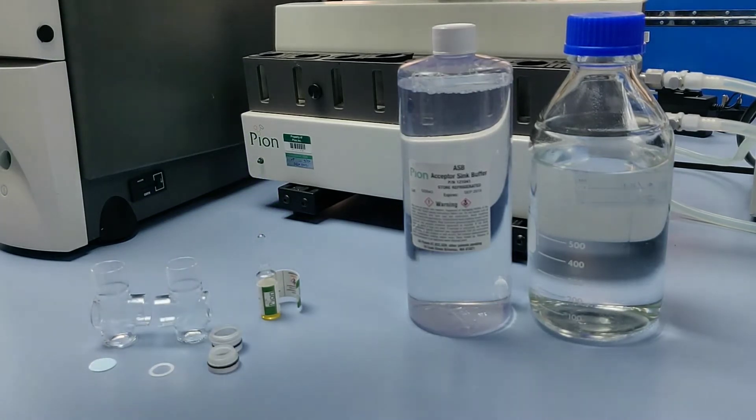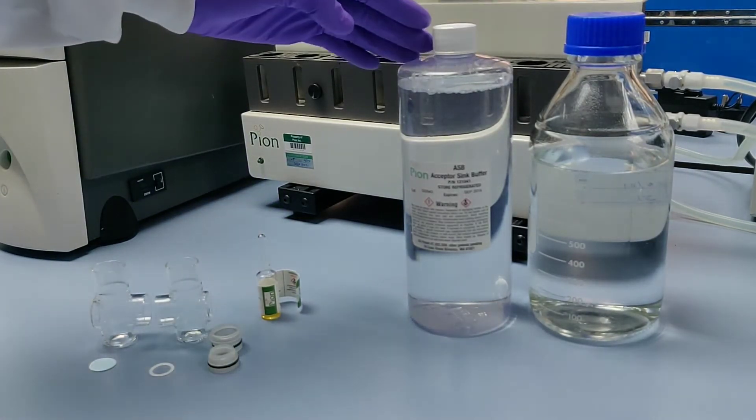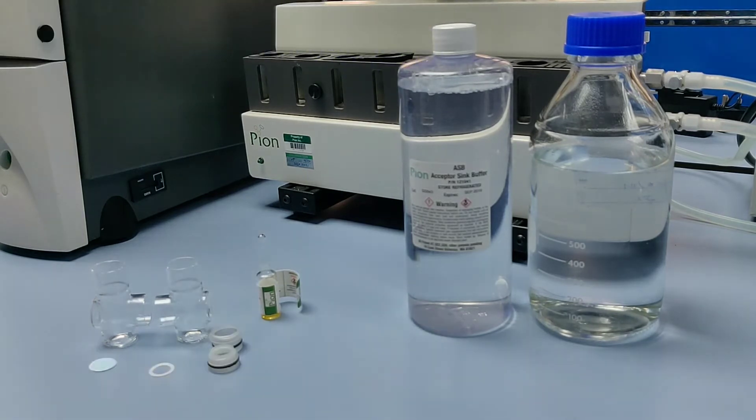Typically, this will be an aqueous buffer in the donor chamber, and acceptor sink buffer, a proprietary solution containing chemical scavengers in the acceptor chamber.